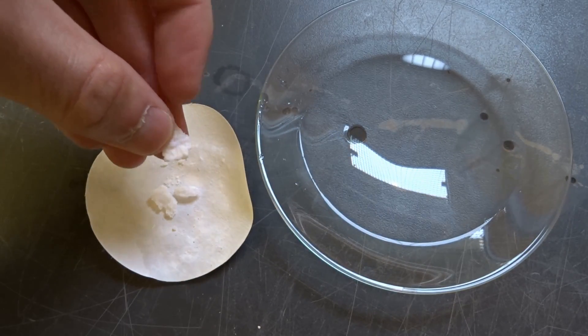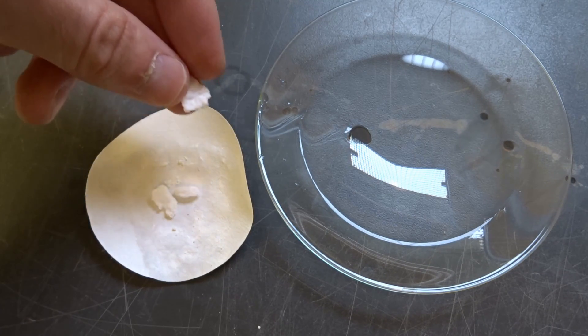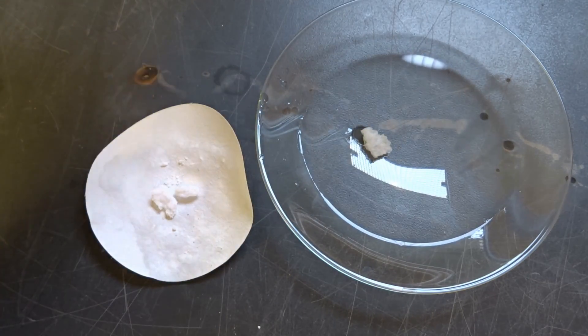And they won't return to their shape in water, so I tested this out, I threw one in, and it just stayed there, didn't change its color.